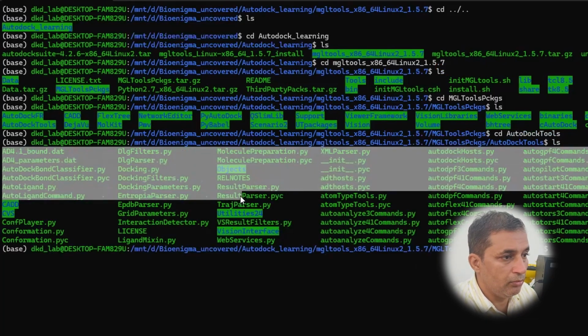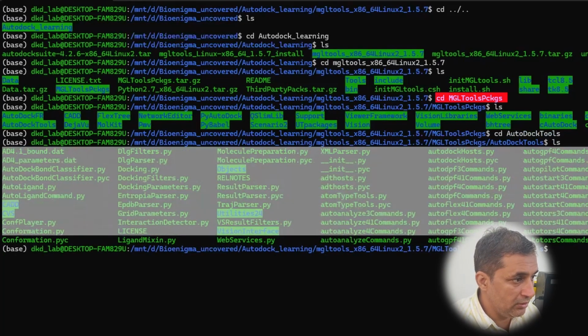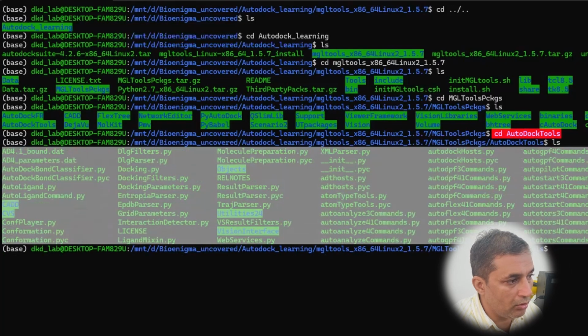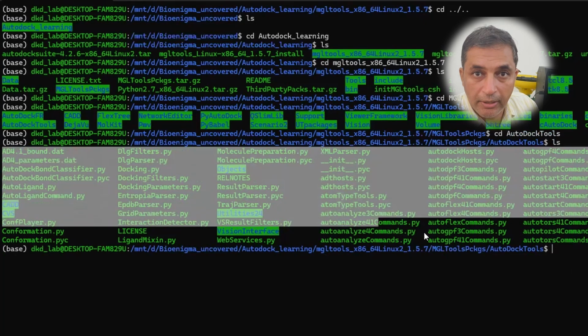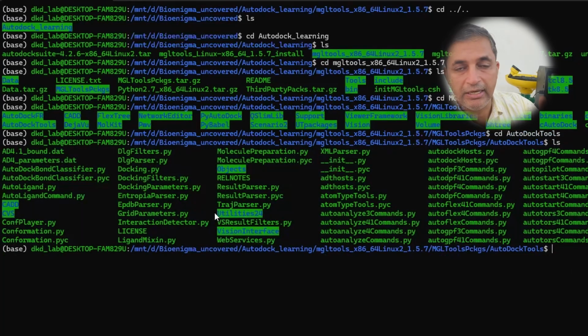Then we are going to move to the MGL Tools packages folder, ls, and then move to the cd AutoDock Tools. Again, press enter, then again in the next line, hit the ls command. You can see that various file types with extension .dat and .py, meaning Python files, are present, which confirm that our installation has been successful.